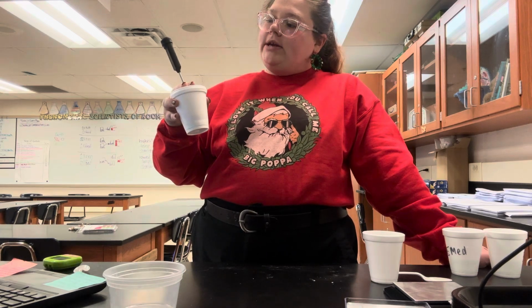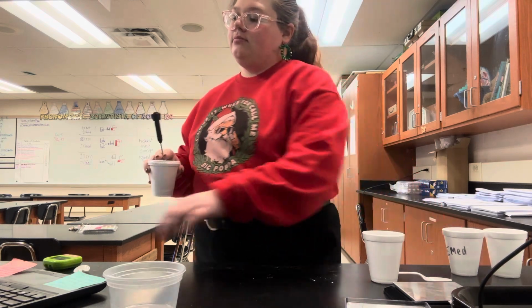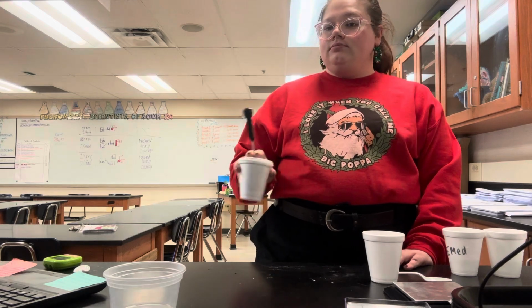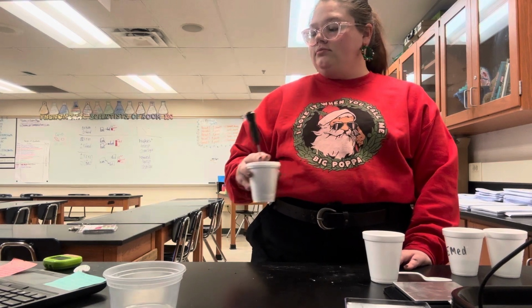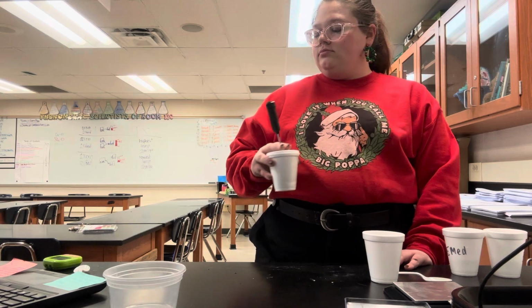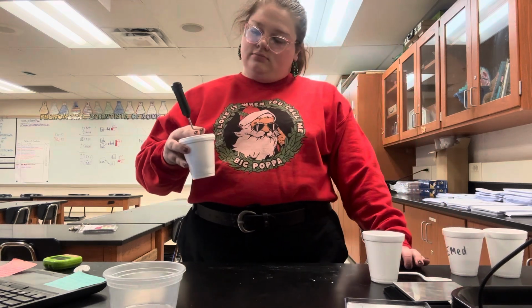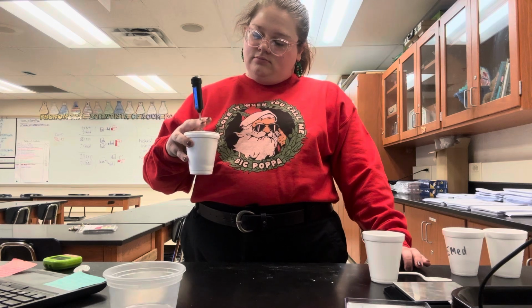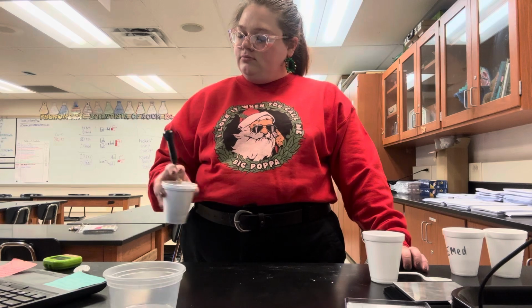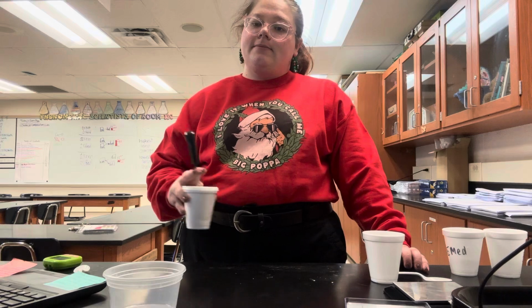Four minutes in, 27.7 degrees Celsius. 4.5 minutes in, we're at 29.2 degrees Celsius.